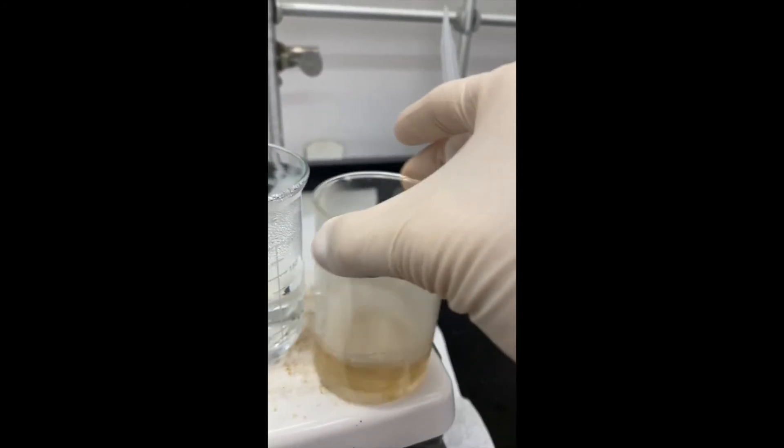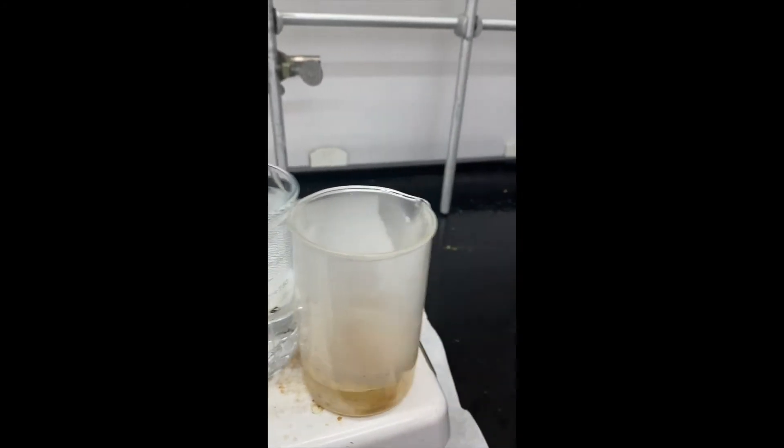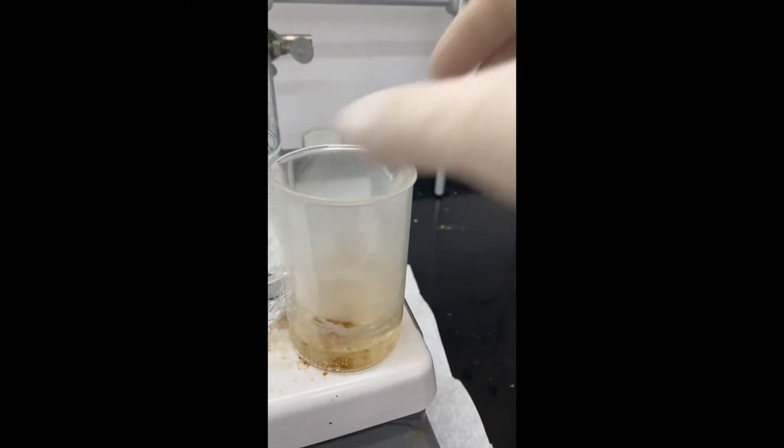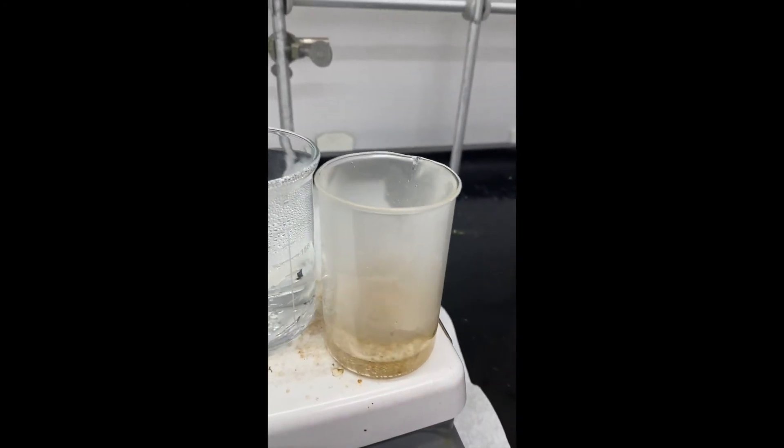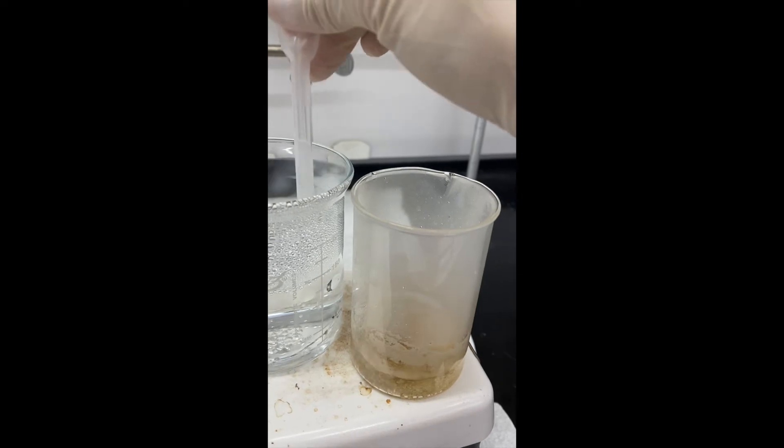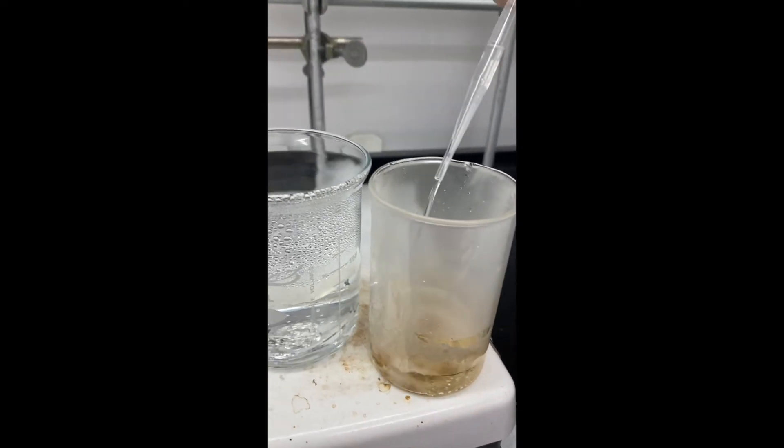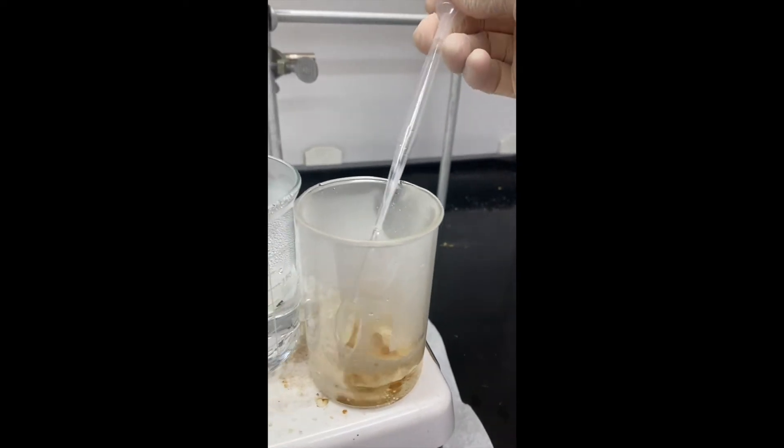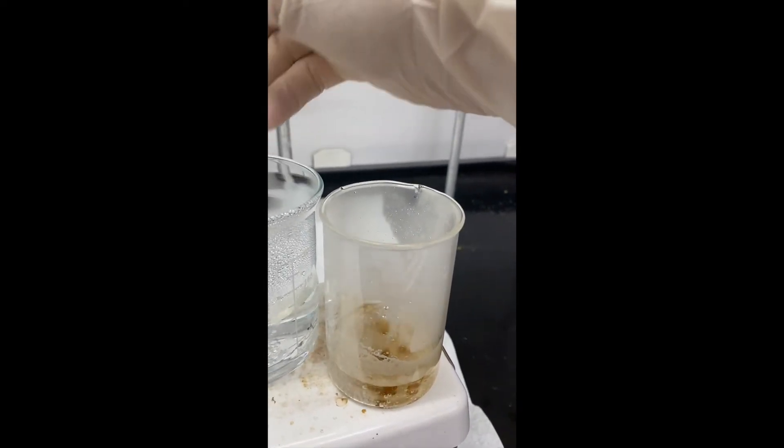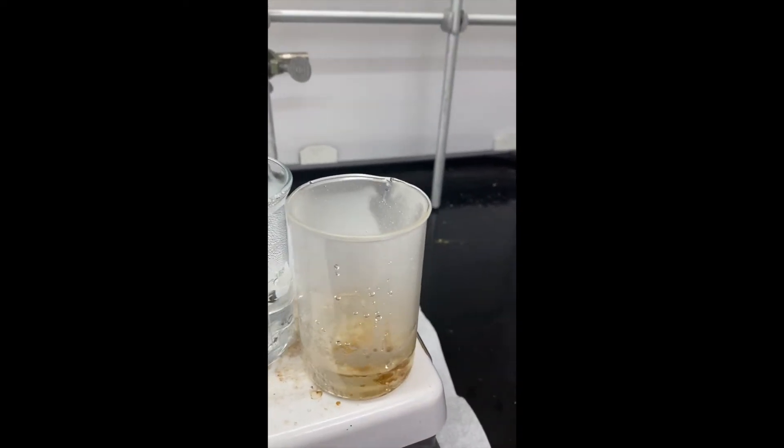So we want to make sure not only we dissolve our compound, but also maybe add a little bit of extra solvent to that solid, or to that solution at this point. So that when our solid crashes out as those nice crystals, we also have more solvent to filter from.